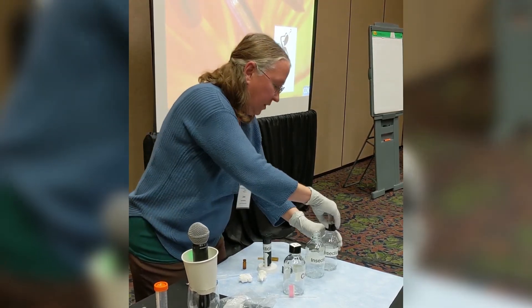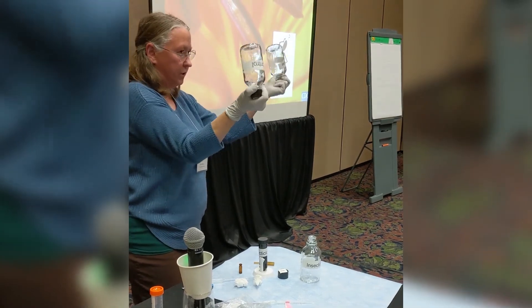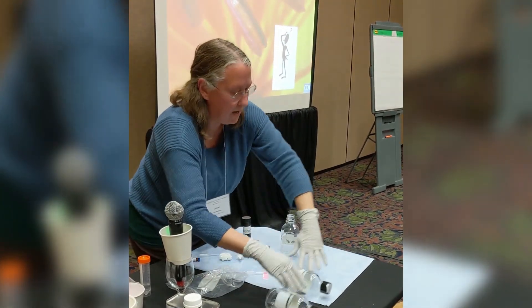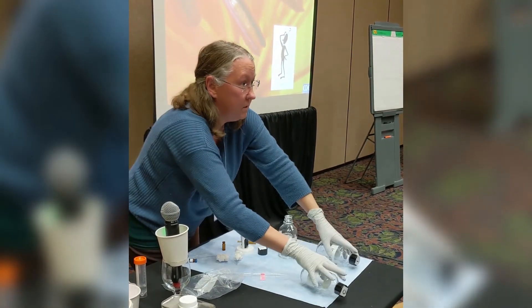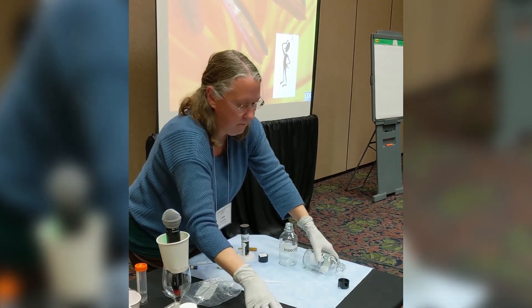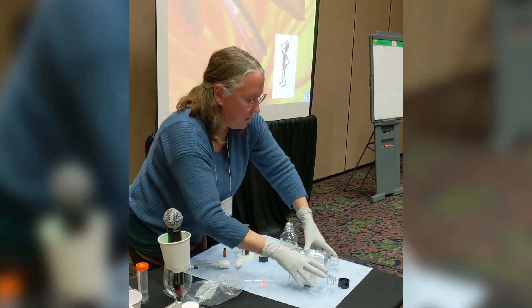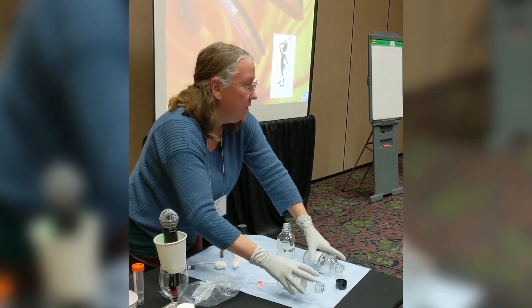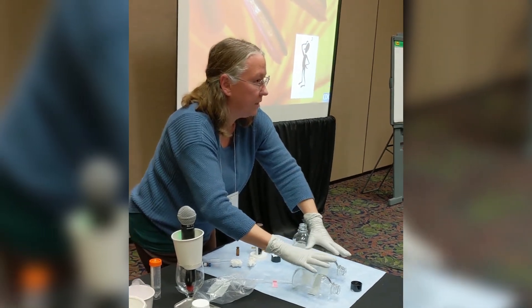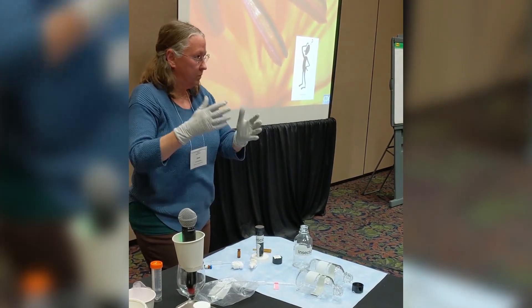Next, cap the bottles and swirl on the bottom. You want to treat the inside of the cap, then roll them back and forth to coat the sides of the bottle for about a minute. Swirl the bottom and top again, take the cap off, and continue to roll it. Once no more liquid is showing, let them breathe for about another half an hour to an hour. I usually put them in a dark drawer to protect them, and then they're ready to use.